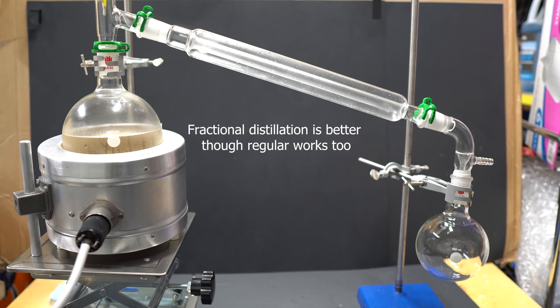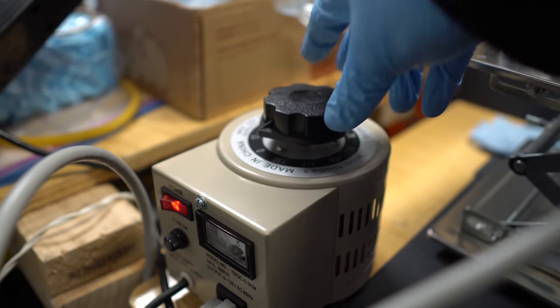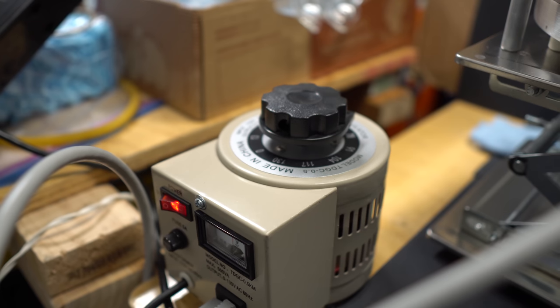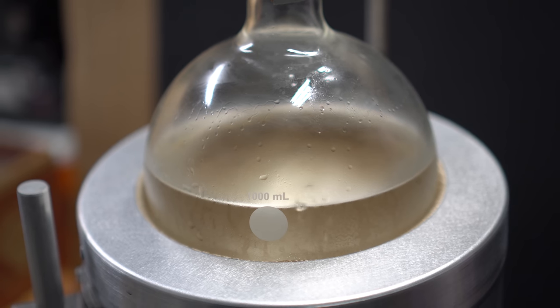Once everything was defrosted I set up for a simple distillation. I did a simple distillation, however a fractional distillation would probably be a better idea as you can get a little bit more of a pure product.